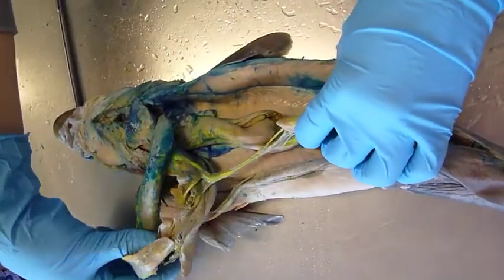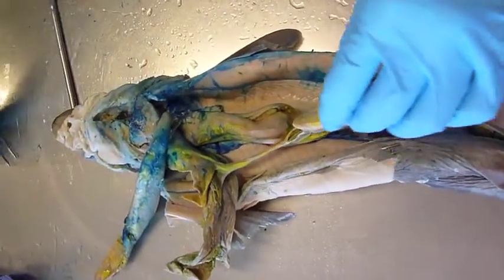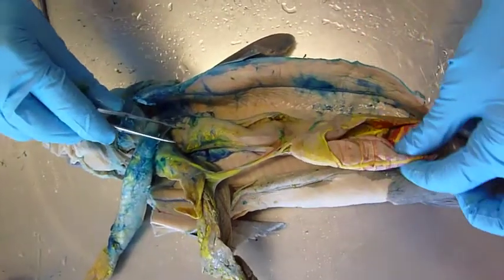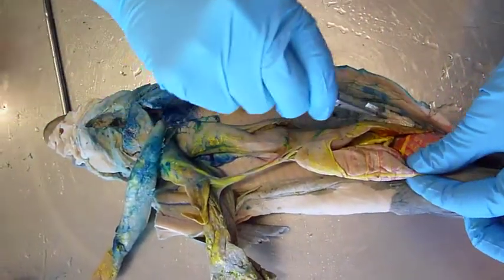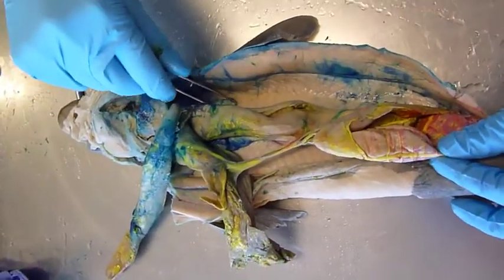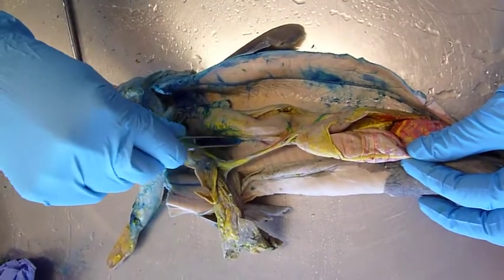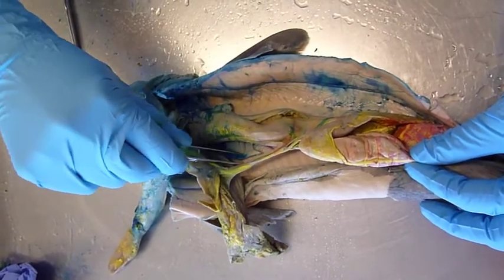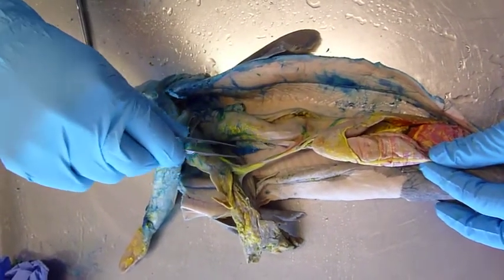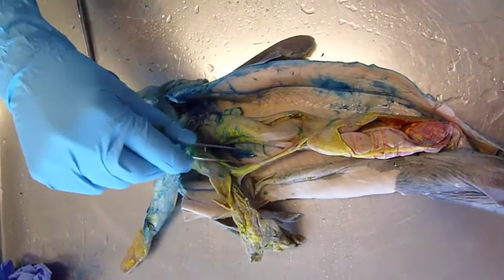If we move the liver out of the way, you can see a gigantic stomach. And on both sides of the stomach we have the gonads, which in this case are ovaries because we have a female shark.